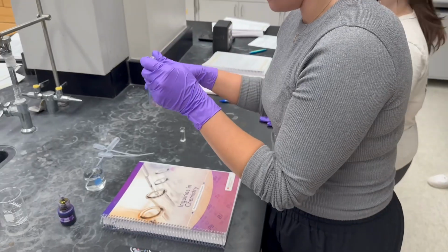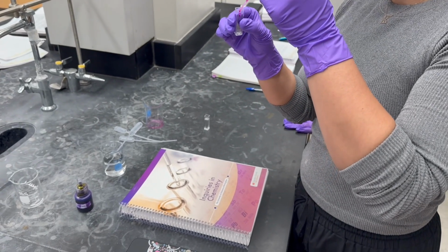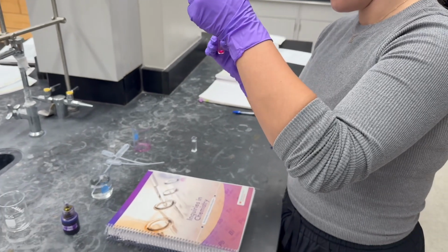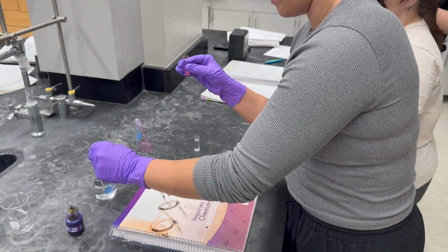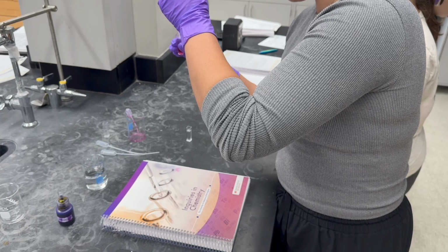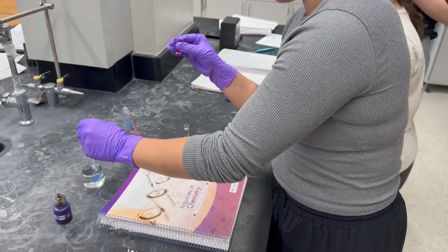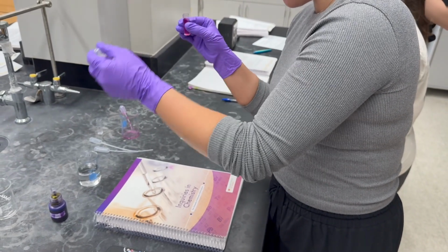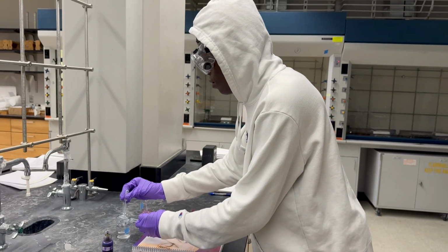Once the series of dilutions has been placed into the cuvettes, we're going to head down to the lab to get our wavelength. Once we get into the lab, we are going to find a station and set the computer up and make sure that it's running the proper app so that we can see the graph of our dilutions. Before we can continue with running our samples, we have to make sure that we fill a blank into the spectrophotometer and ensure that we zero the scale so that all of our readings will come out accurate.